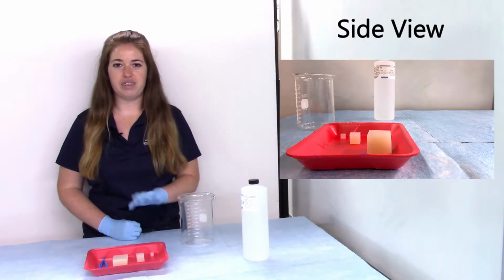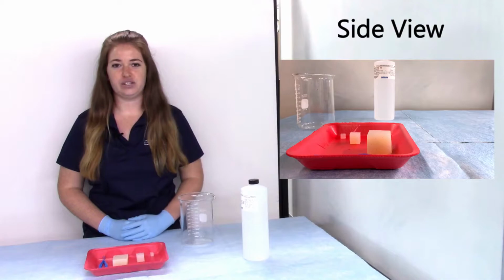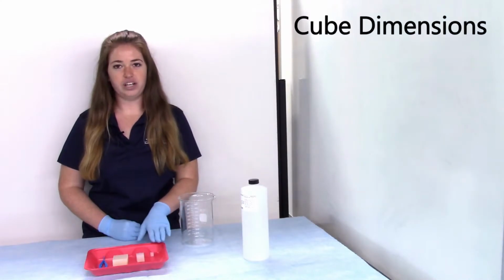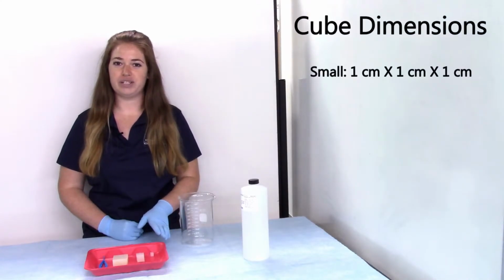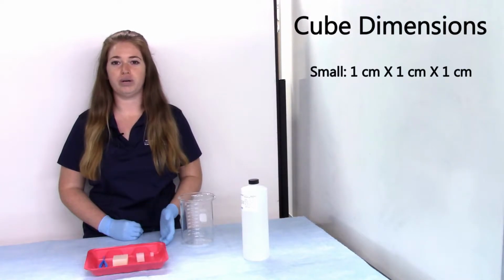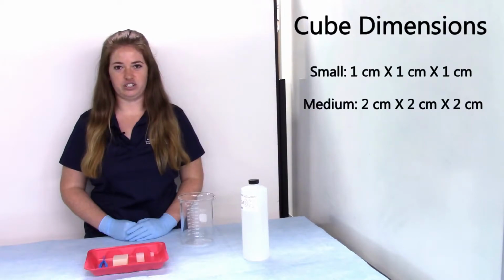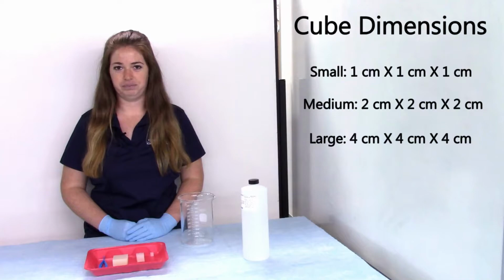We are going to put these 3 agar cubes in sodium hydroxide. Sodium hydroxide is a basic substance, and as it diffuses into the agar, they will begin to turn pink. These 3 cubes have 3 different sizes. The small cube is 1 centimeter by 1 centimeter by 1 centimeter, or 1 centimeter cubed. The medium cube is 2 centimeters in each dimension, and the largest cube is 4 centimeters in each dimension.